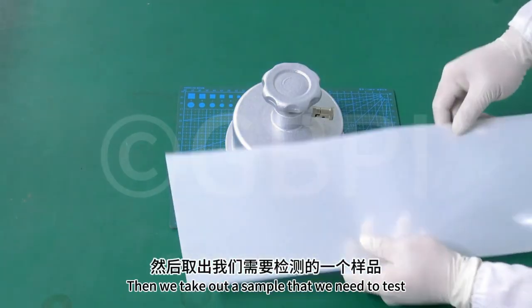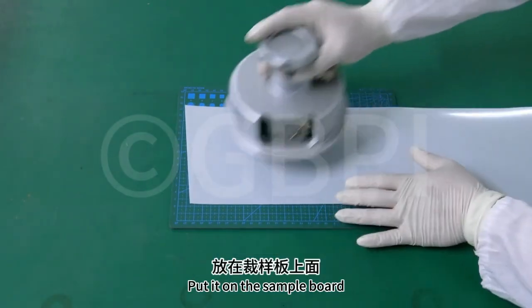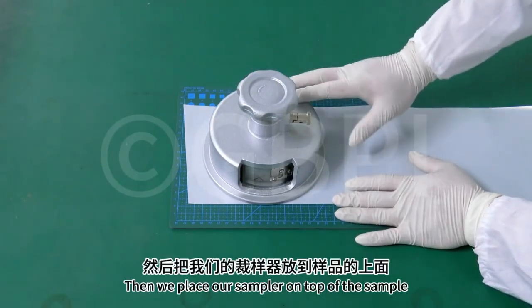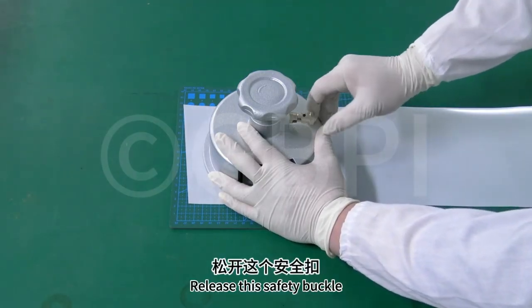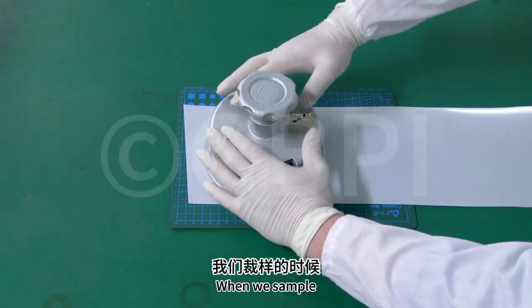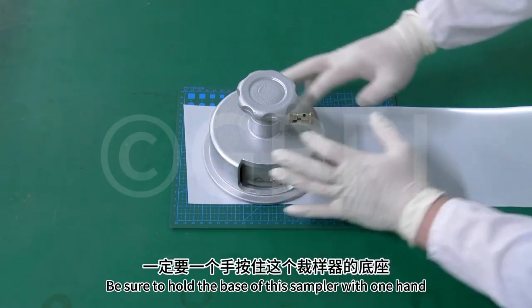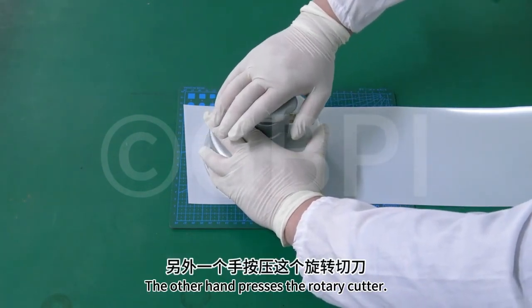Then we take out a sample that we need to test. Put it on the sample board. Then we place our sampler on top of the sample. Release this safety buckle. When we sample, be sure to hold the base of this sampler with one hand. The other hand presses the rotary cutter.